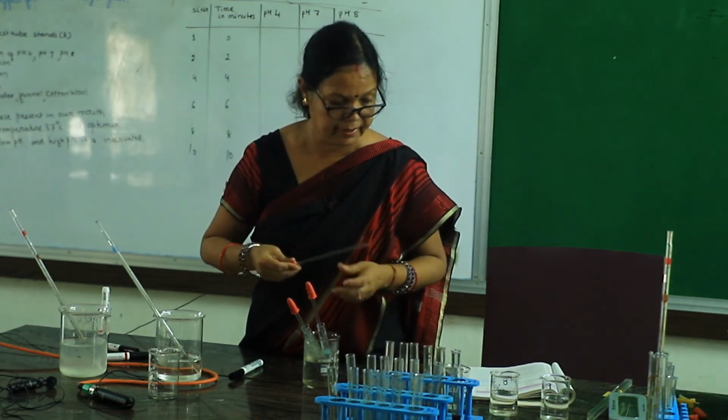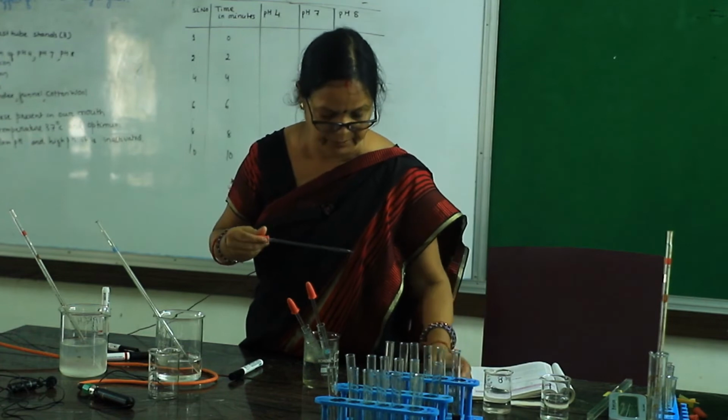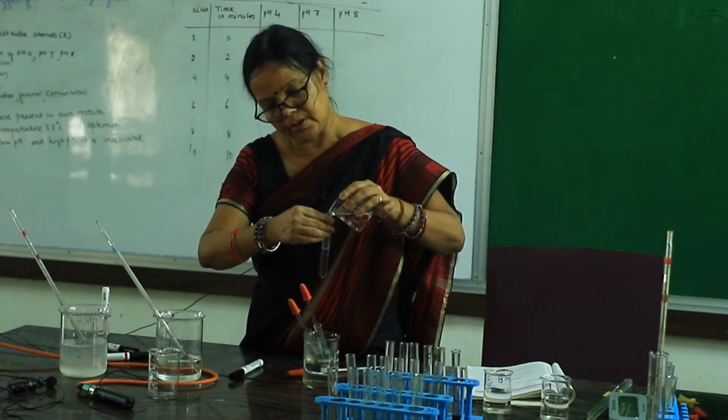Then take a third dropper, and you have to take pH 7, 6.8 or pH 7. You just add up to 1 milliliter.